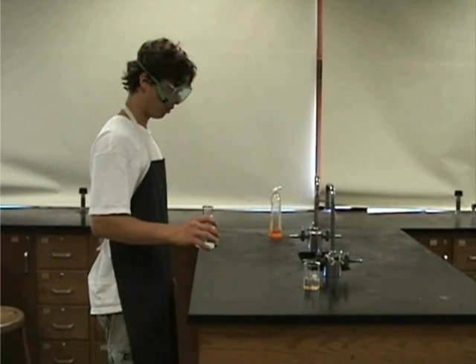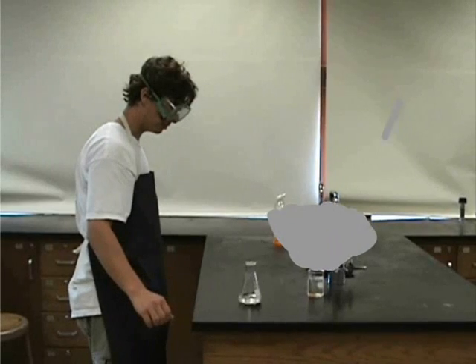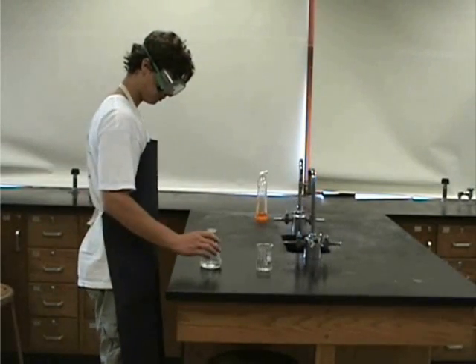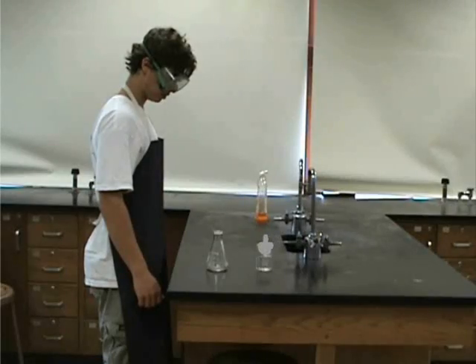I'm about to add water to acid. That is not good. I'm about to add acid to water. The reaction completed safely and I was not harmed.